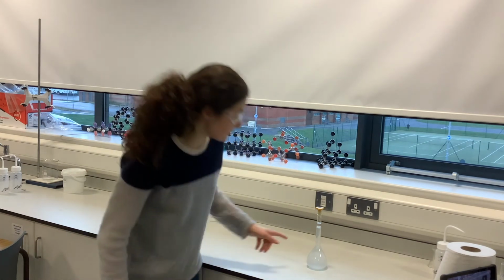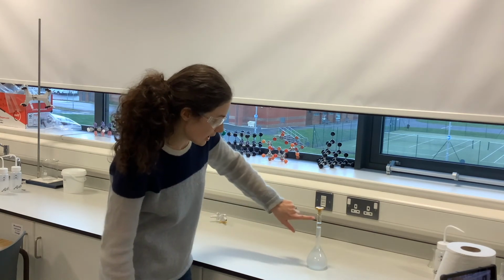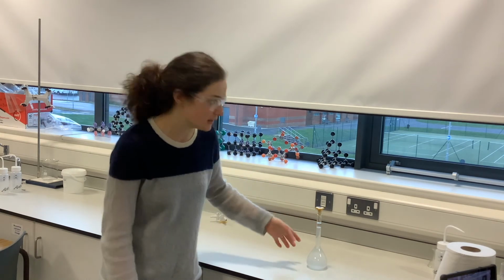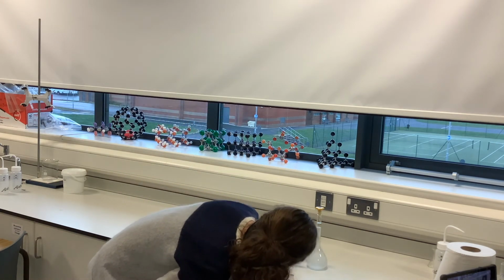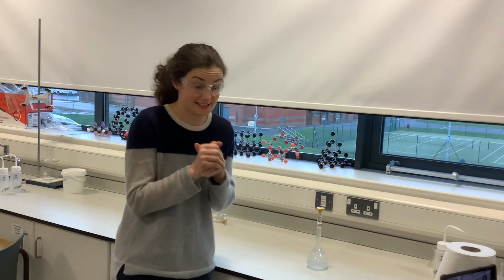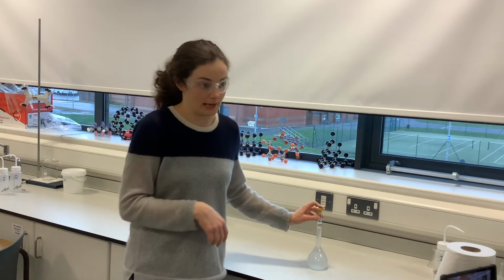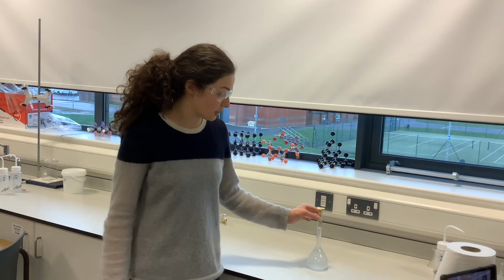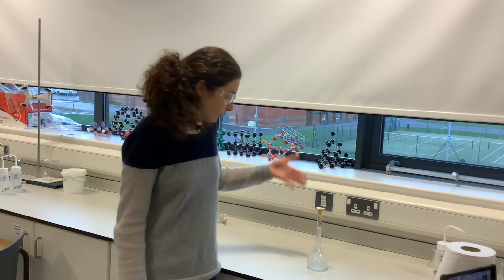Now, sometimes when you do this, the level of your meniscus can appear slightly below the line, and that's because some will be on the walls of the top of the neck of your volumetric flask. So if I have a look now, it's hard to see that line actually because it's a wee bit bubbly at the top. The bottom of the meniscus is actually slightly below the line. That is absolutely fine. You do not then add a little bit more in, because as I said, there'll be some coating just the inside of the top of the neck, and that will flow down eventually.